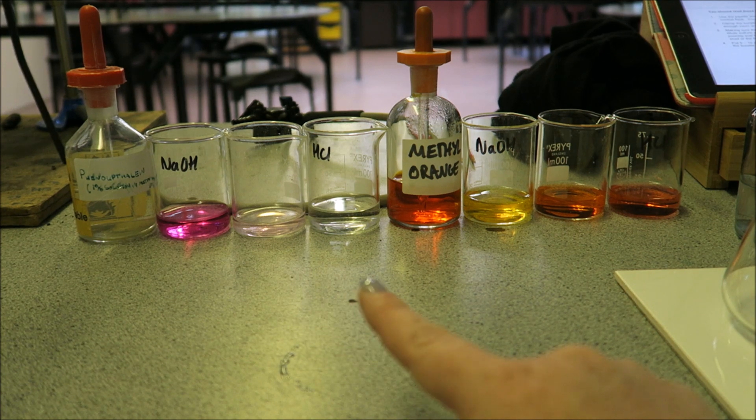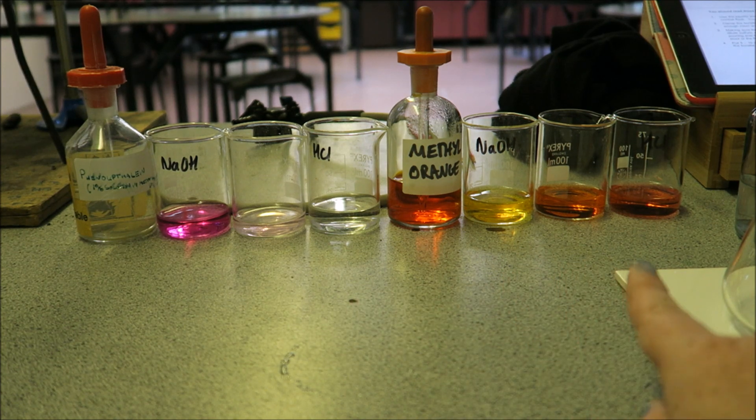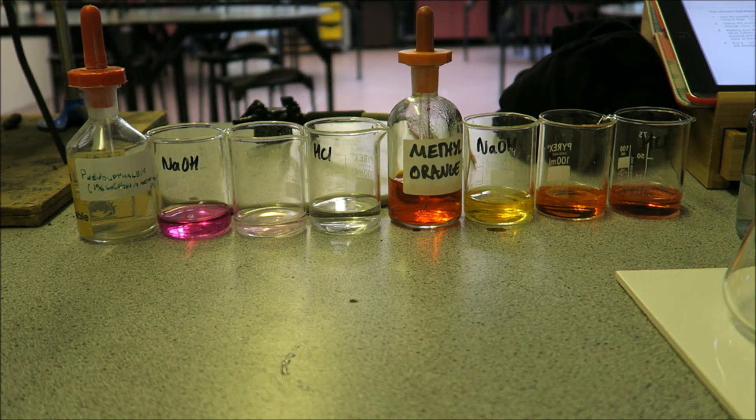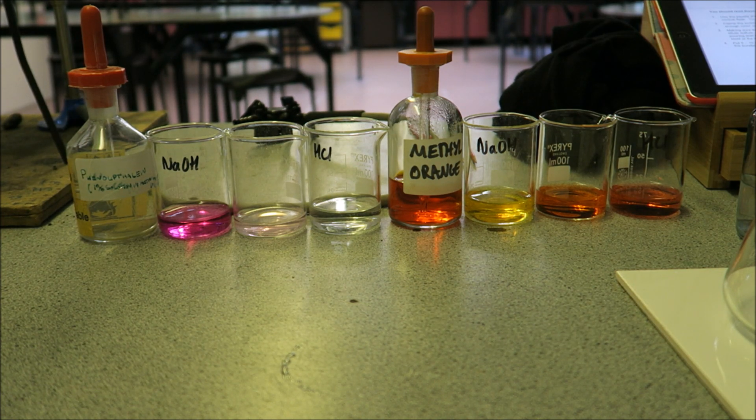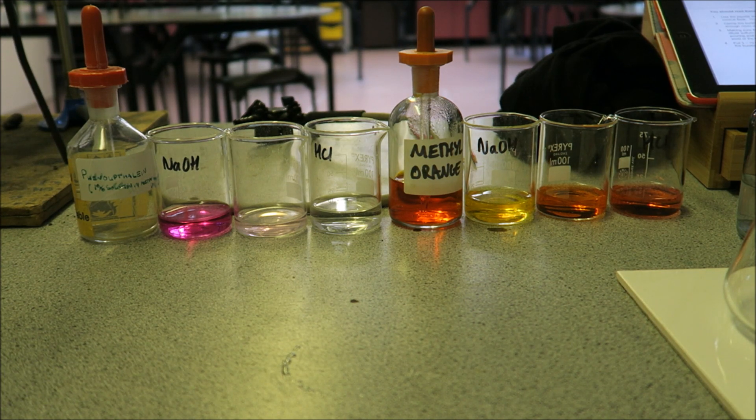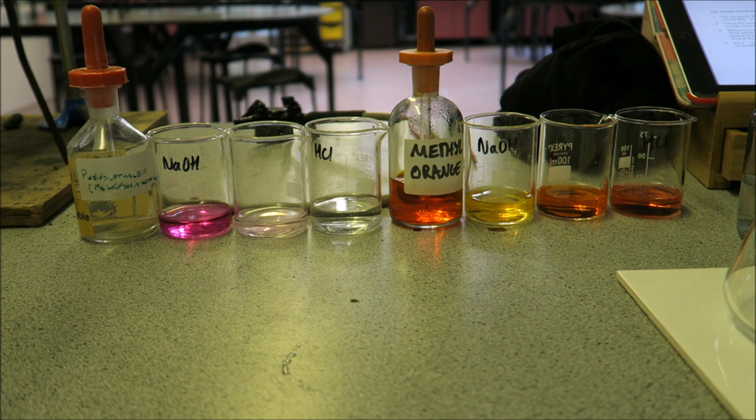With alkali, endpoint, acid. If you're not sure about what they look like in alkalis, acids, or at the endpoint, it's always worth just doing this first and maybe keeping a reference so you can have a look at it while you're doing the experiment.